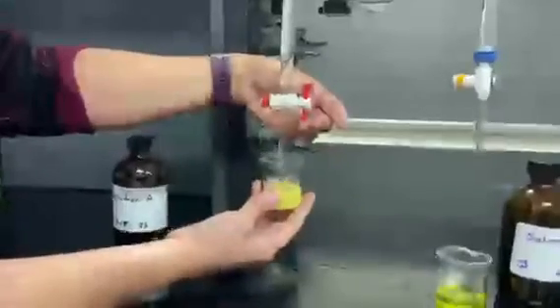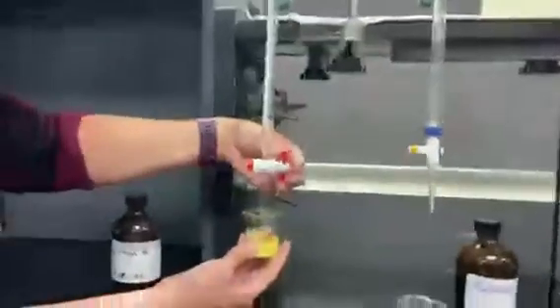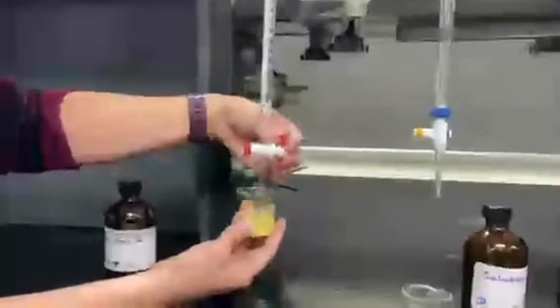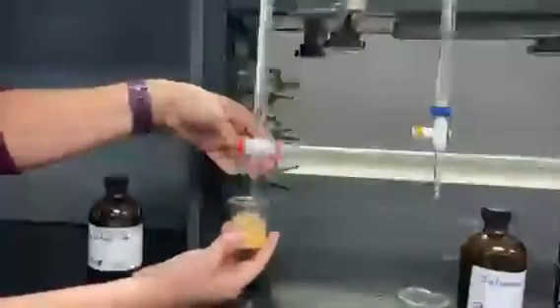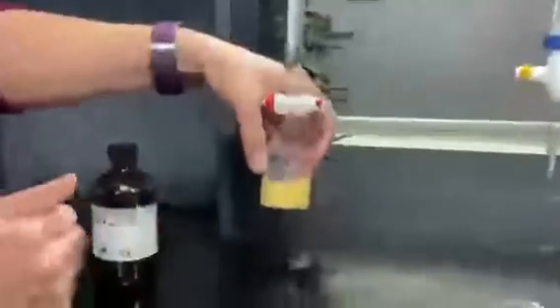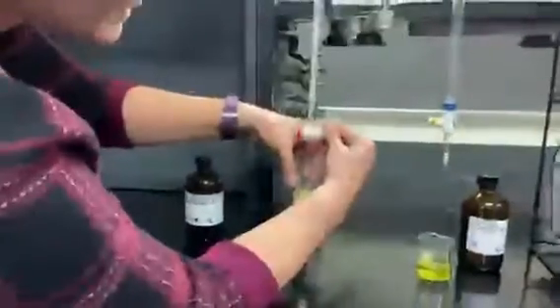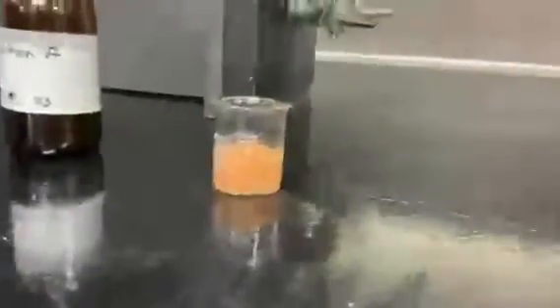It's when that brown color decides to stay for good that we stop the titration, and it's getting there, I promise. The hardest part of chemistry sometimes is being patient, that you will get the results. I'm going to stop for a second because it looks like I got a lot of brown there. Oh, almost. Okay, I'll add a couple more drops. Hope that I'm there. Patience is a virtue that I don't really have. And there we go. Notice that brown color staying.